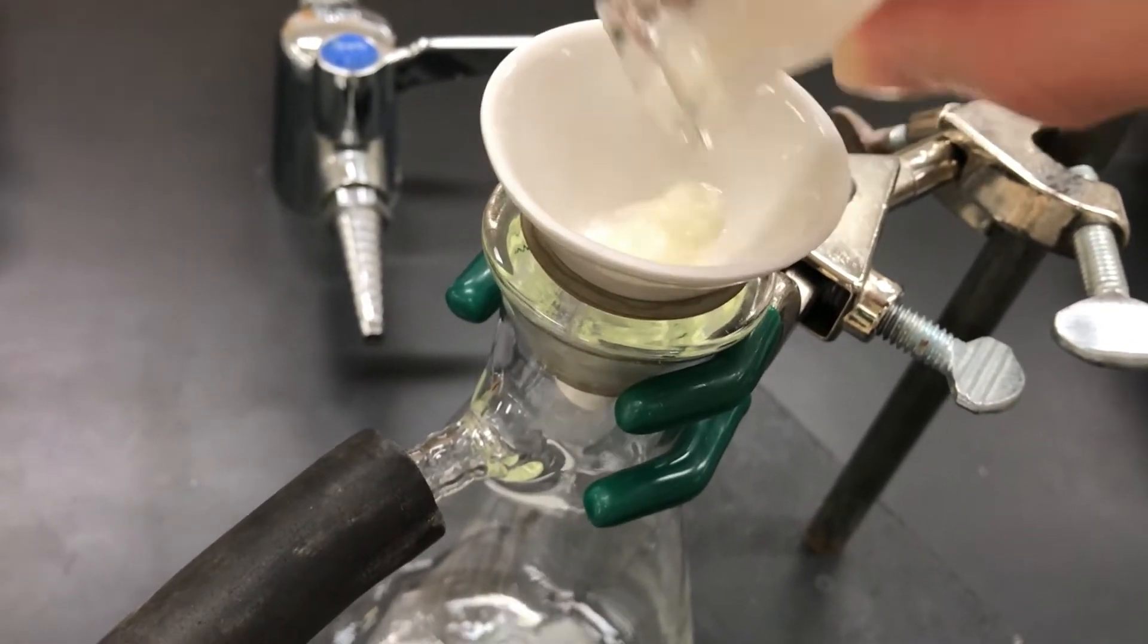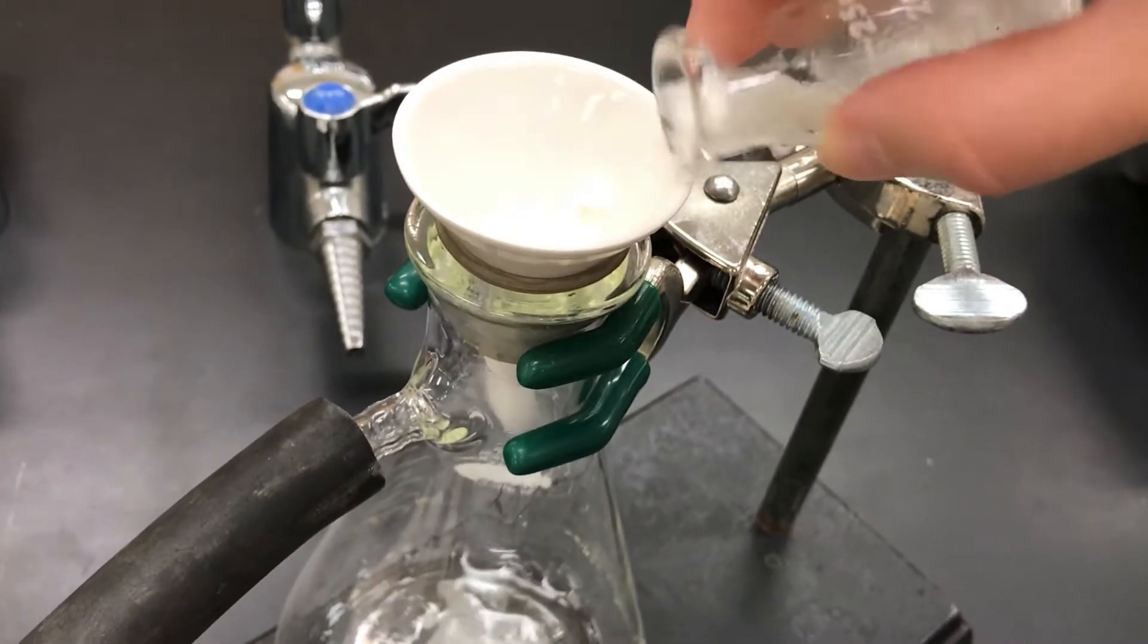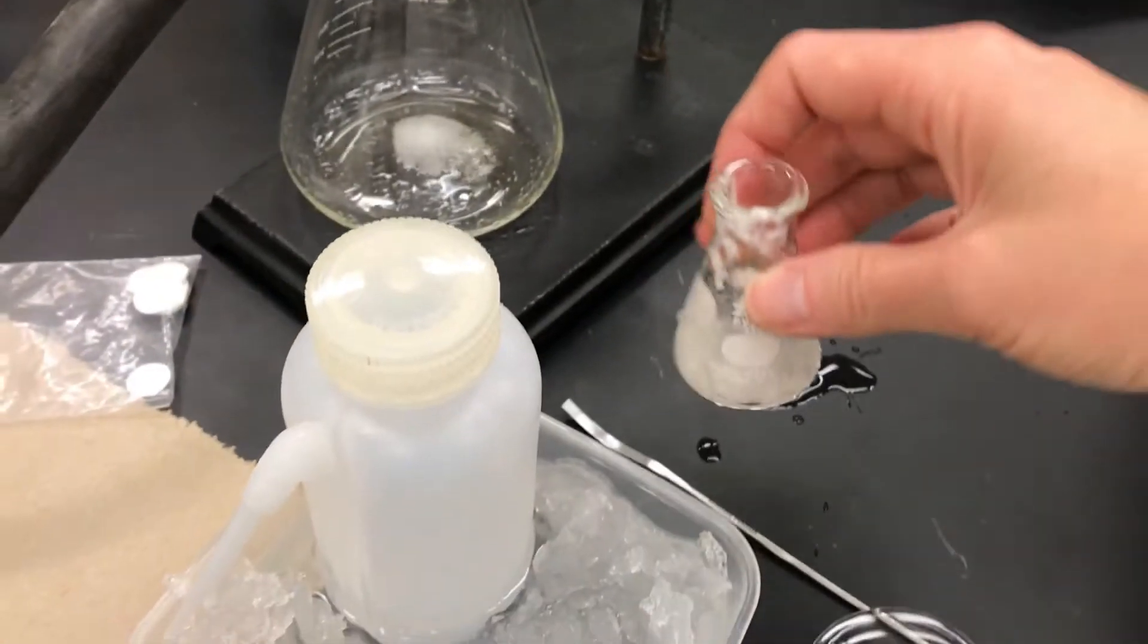The solid liquid slurry—and the liquid is being pulled through with the vacuum—and it's filtering.